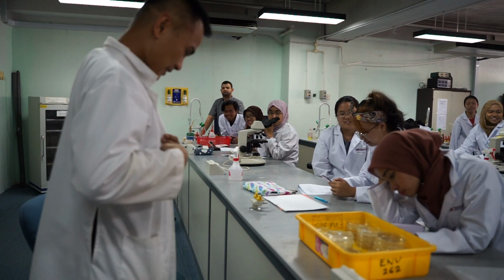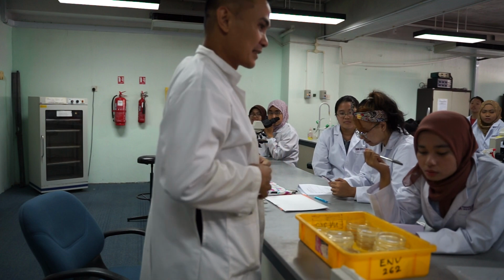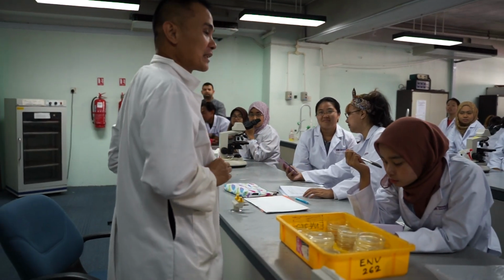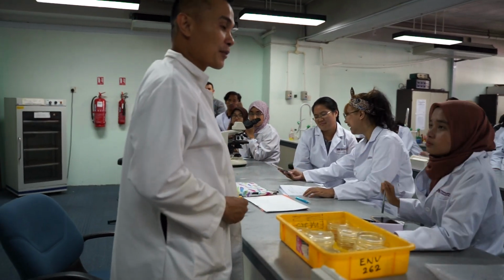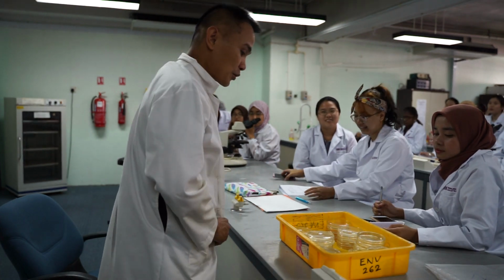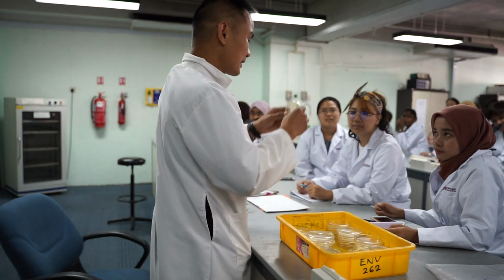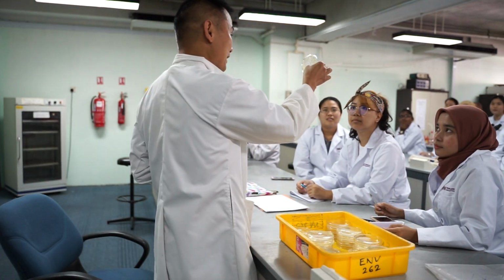Sorry for the delay. So welcome to, I think this is our last lab for these sessions, yeah? So basically we're going to learn, what have you learned from last week? You've learned on how to count how many bacteria there are in water, yeah? So you have spread this, and then today, this is from your spread plate, so it's actually very nice.